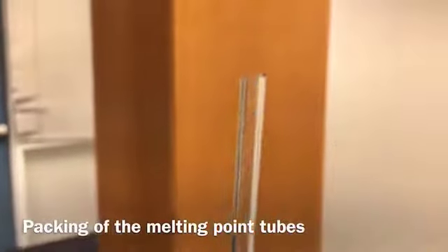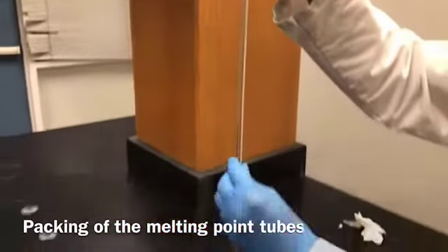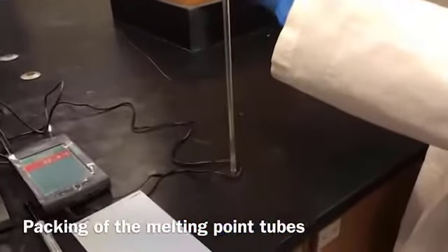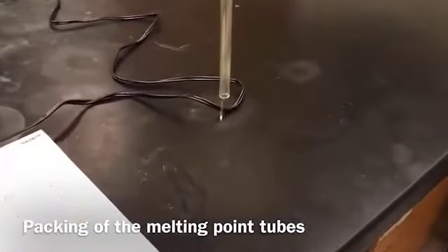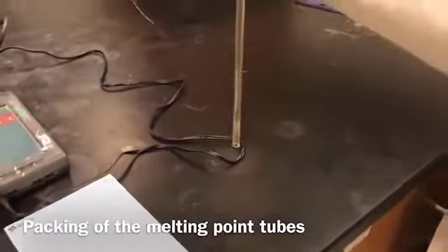So this is my tapping tube. I'm going to slide it here, and you can see it bounces. I'm going to do it like 3-4 times.